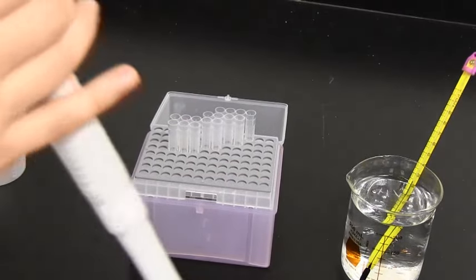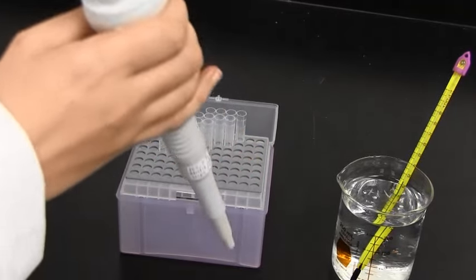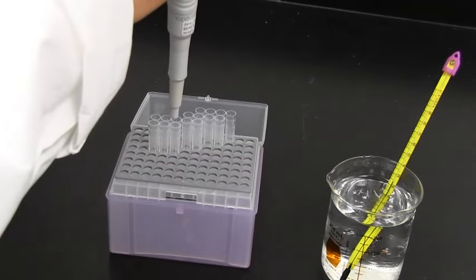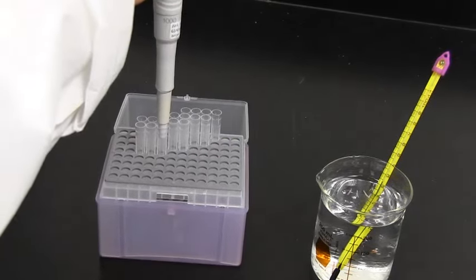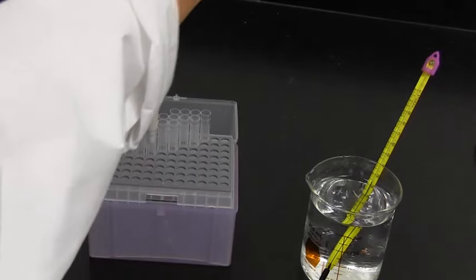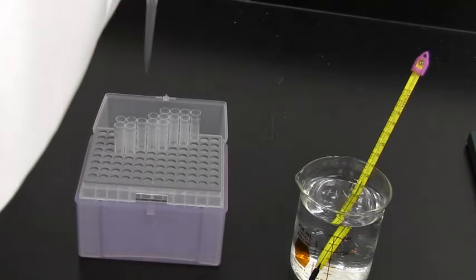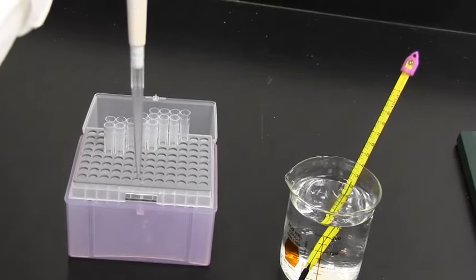In order to put a pipette tip on, we have our pipetter that we're going to be calibrating. And all you do is you just take your pipette, find the tip that you want, and just push it in pretty hard. Make sure that it's not going to fall off. And here you go, you have your tip on your pipetter.